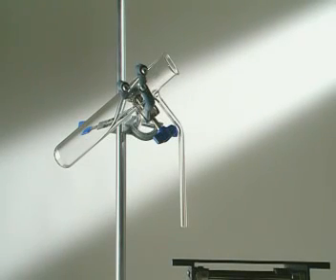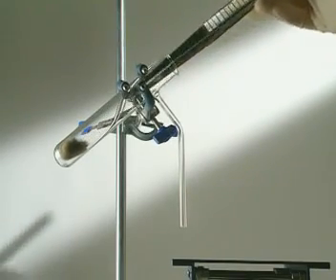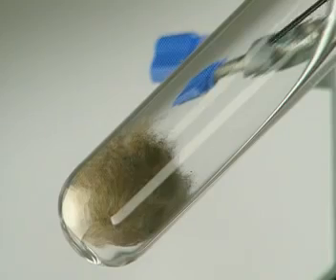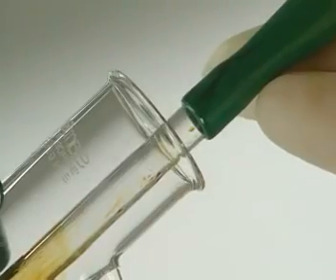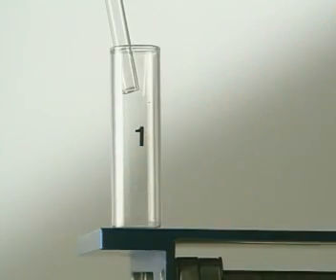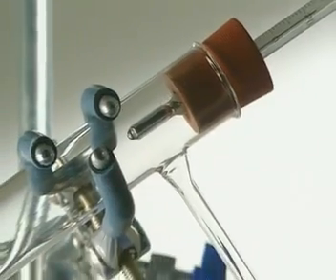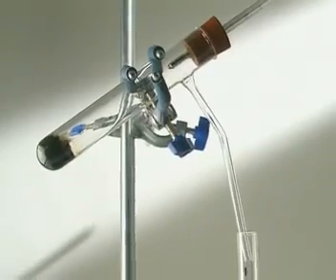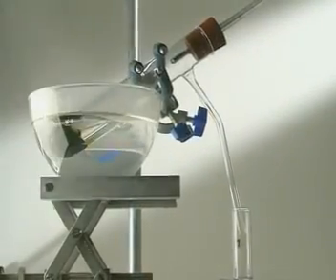This simple apparatus is set up in a fume cupboard. Mineral wool stops the mixture spitting when it's heated. Crude oil is dropped into the bottom of the tube. A collecting bottle is put in place. And a thermometer, level with the sidearm, monitors temperature. The final step is to gently heat the mixture by immersing the tube in a hot water bath.